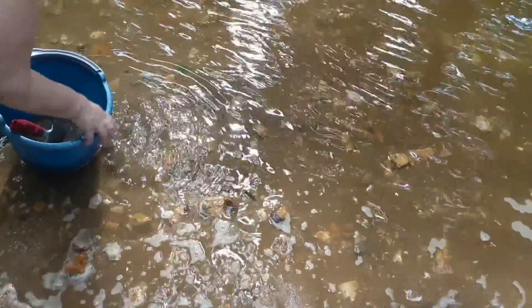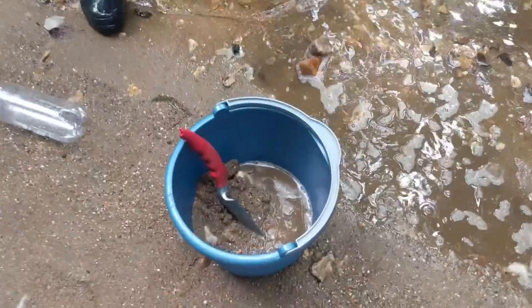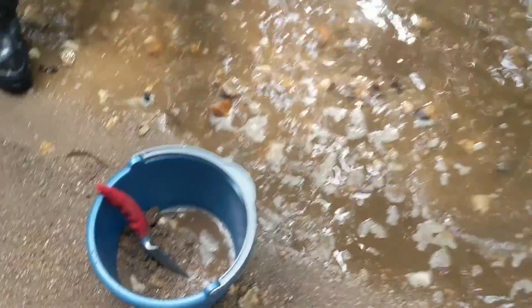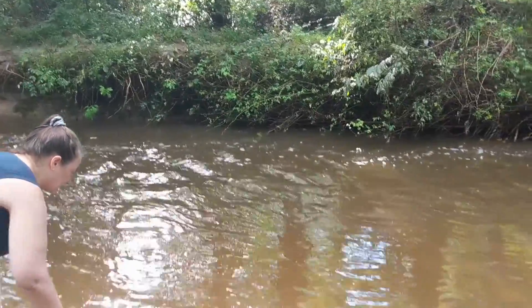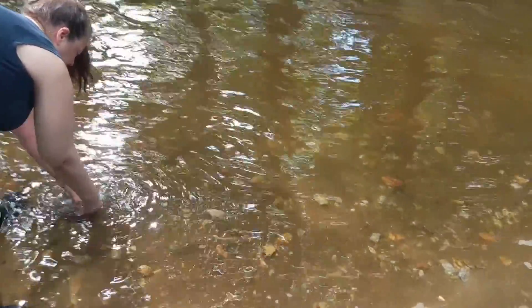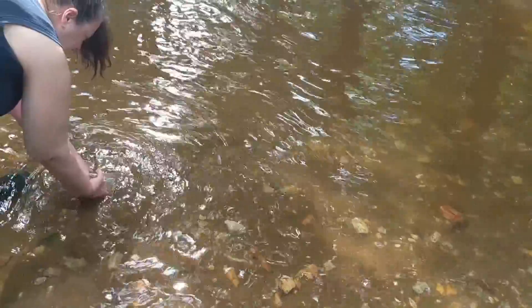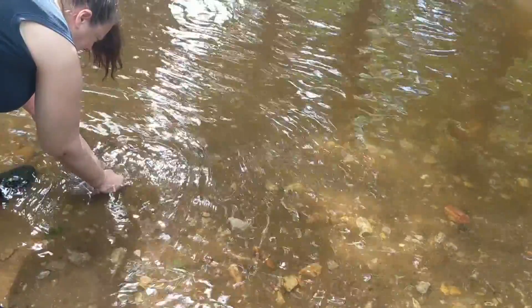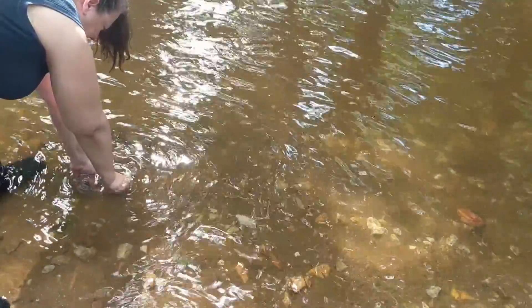After we've collected our mud and sediment, we're just going to fill this bottle up with some fresh water from the same source. We won't need a whole bottle full, but we want to make sure we have enough to top off our Winogradsky column when we put it all together.